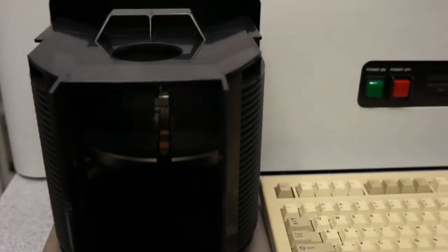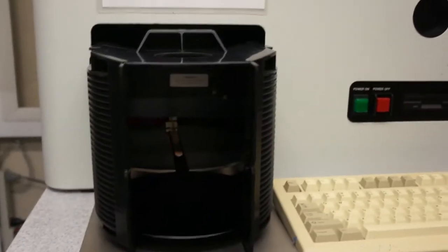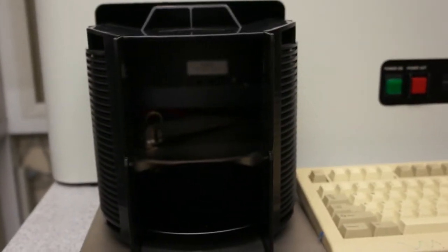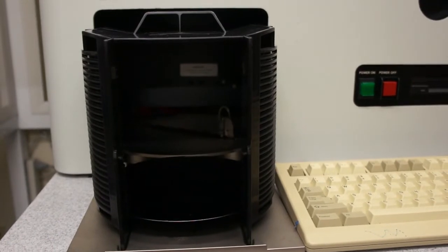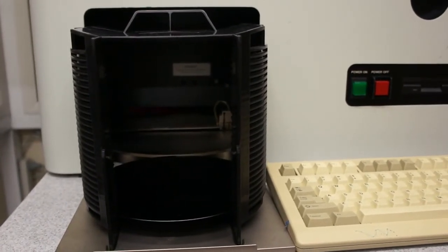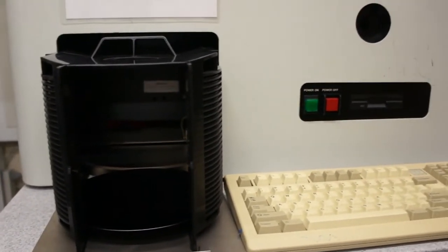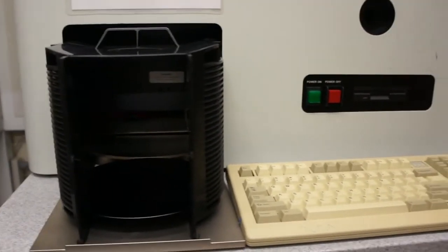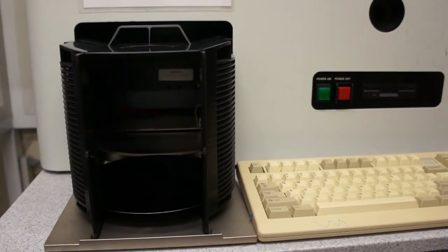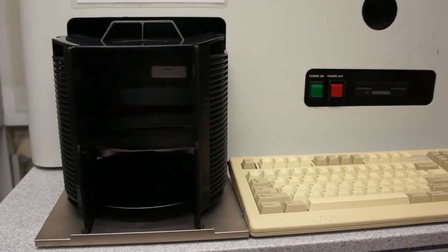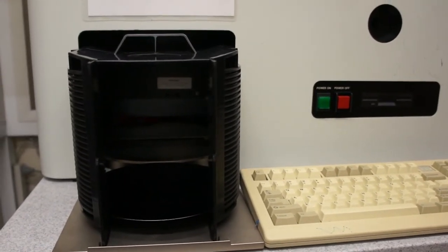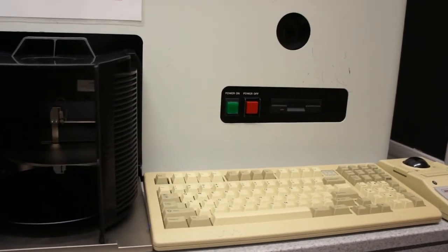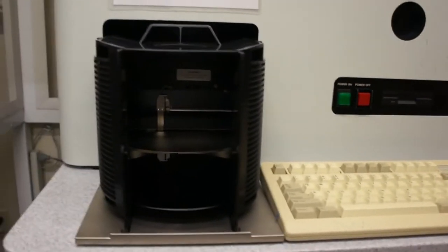Here we'll see the handler initialize. So obviously this tool came with very old peripherals. Our keyboard and our mouse or trackball will obviously get replaced.